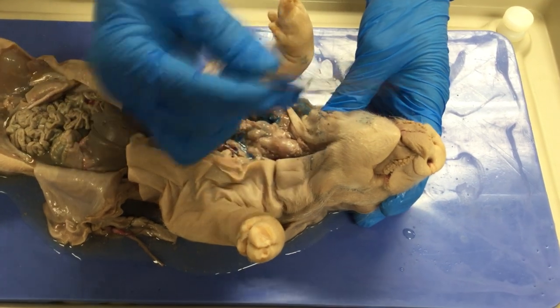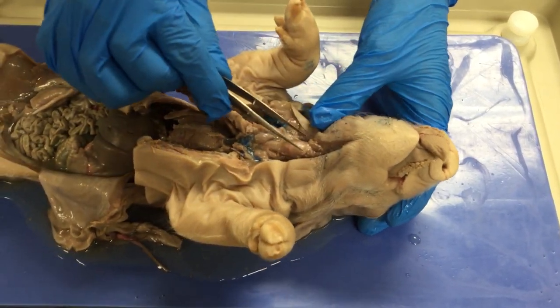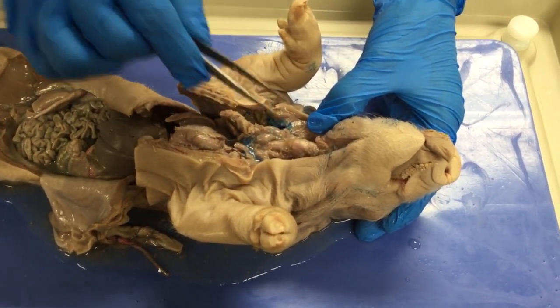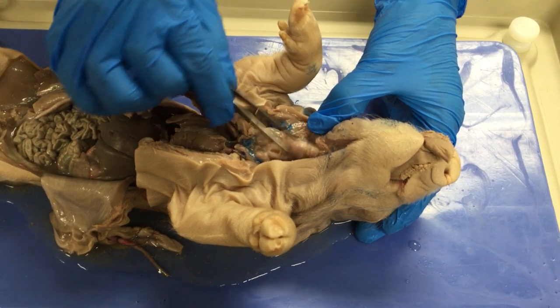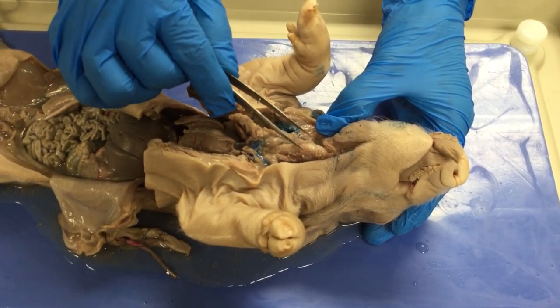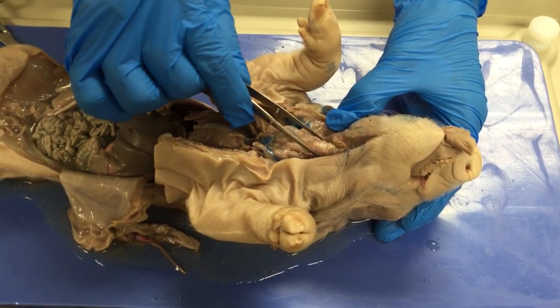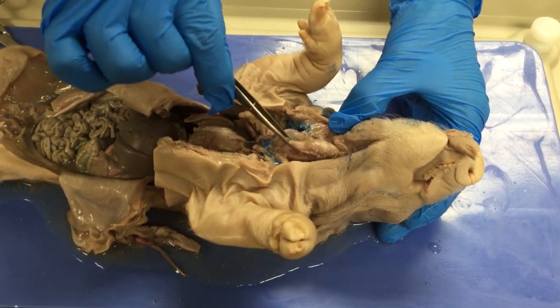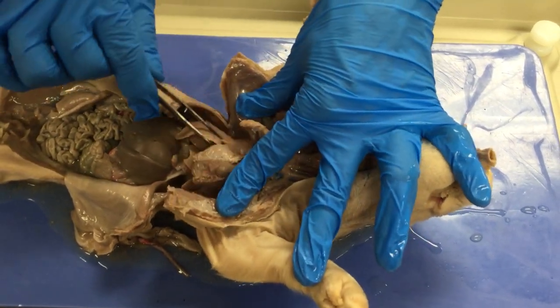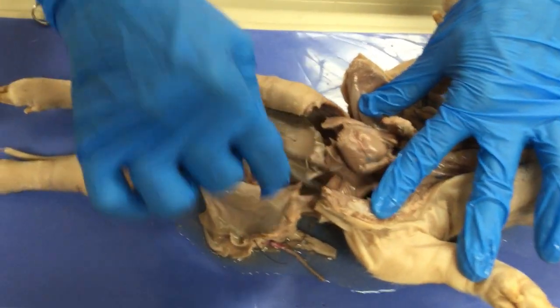When we are breathing as part of the respiratory system, the nose brings air into the pharynx first — a shared tube between the digestive and respiratory systems — and then into the larynx. Air flows from the nose into the pharynx, into the larynx, and then into the trachea, and then into our lungs, of which we have two. This is the right and this is the left.